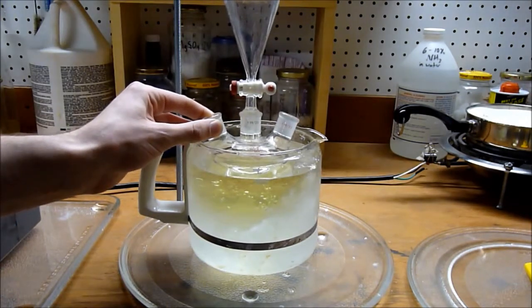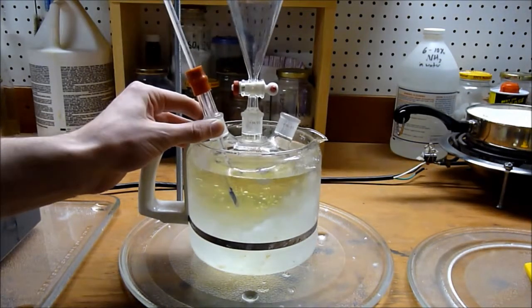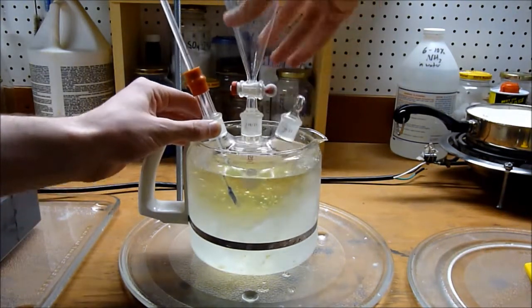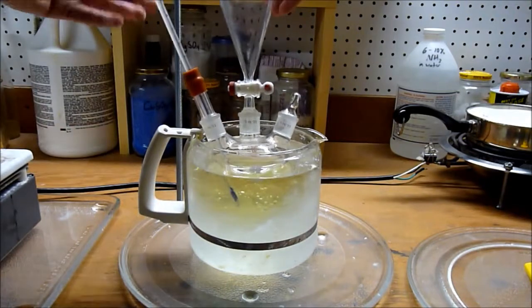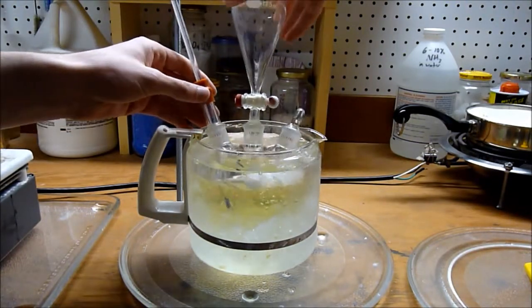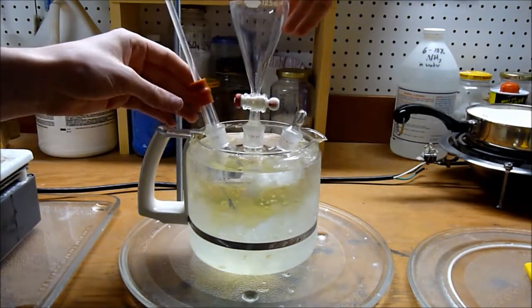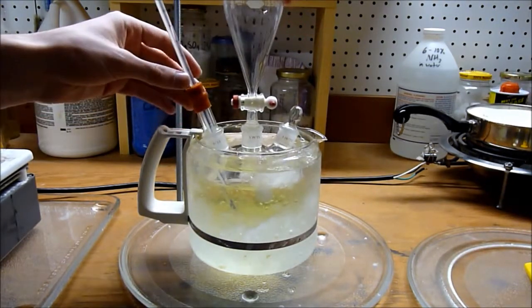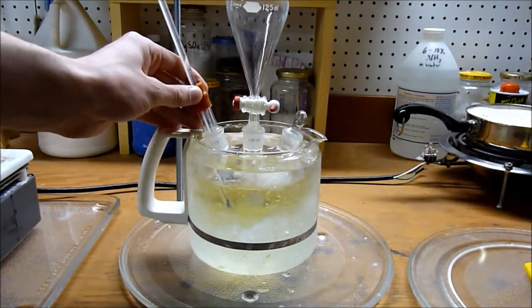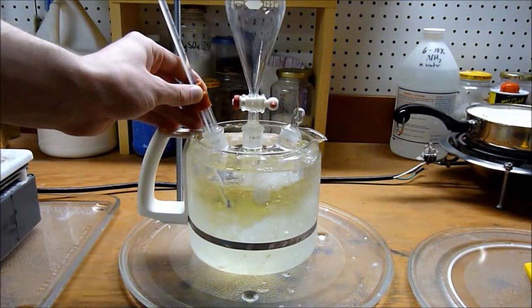We're going to monitor the temperature using this thermometer, and the other well will be closed up with a stopper. I'll have to adjust the stand to hold everything up. I'm going to need some additional support for this. I'll be back in a second.